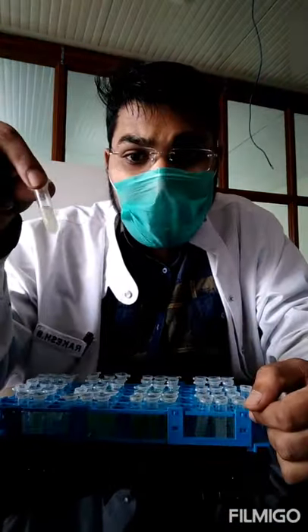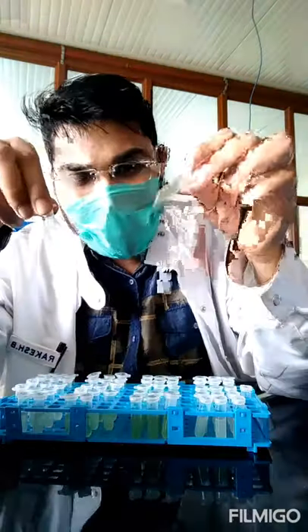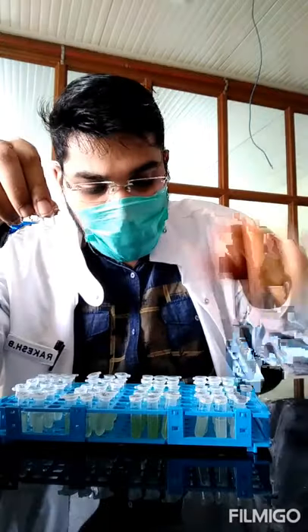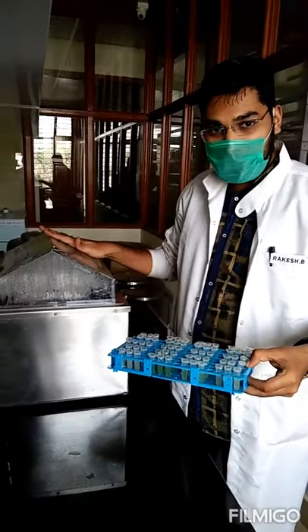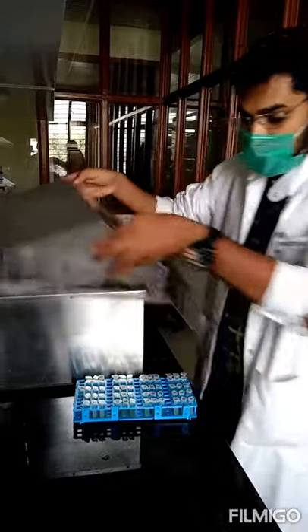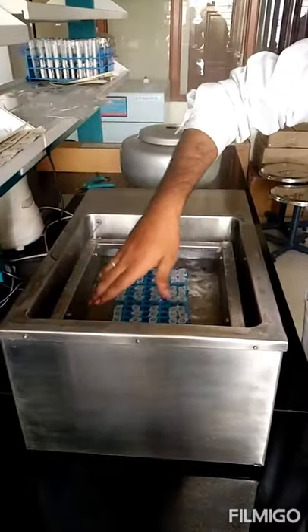Before incubation, I can show you a color difference: the root sample is light white and transparent, the leaf sample is becoming bluish-green, stem is light green, and seed samples are still whitish. My water bath is ready at 95°C and I am now placing the entire stand of eppendorf tubes in the boiling water bath for one and a half hours.